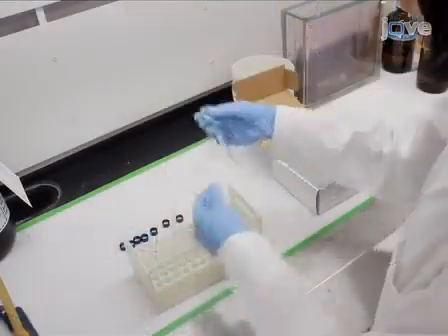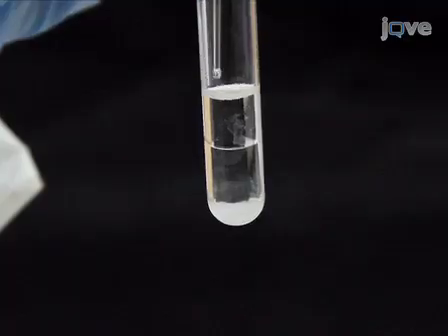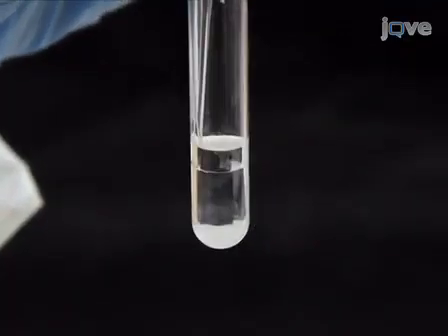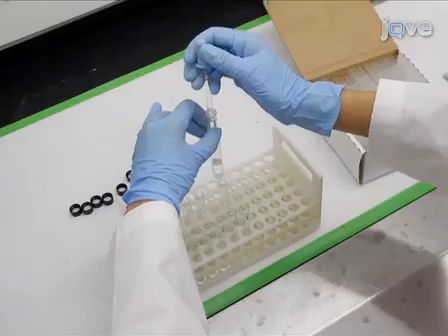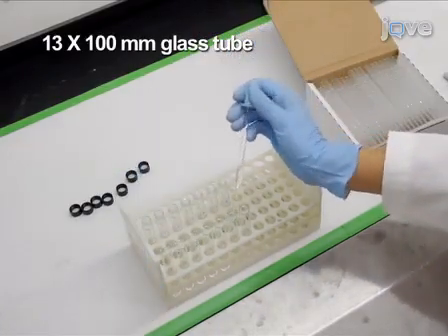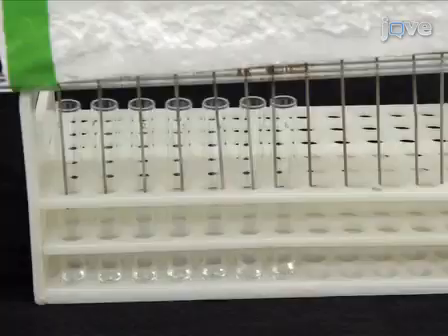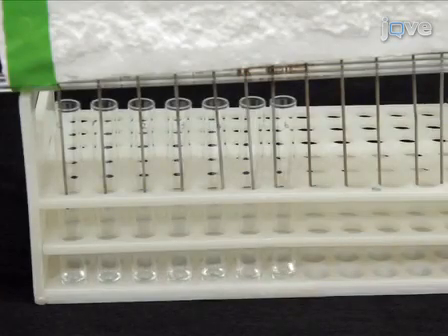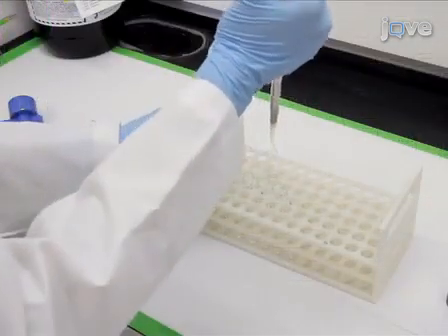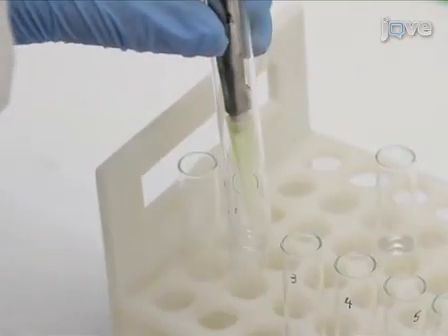Following centrifugation, remove the hexane upper layer of the sample with a Pasteur pipette in the fume hood and place it into a new 13 by 100 mm glass tube. Evaporate the hexane under a slow stream of nitrogen without drying completely. Dissolve the resulting fatty acyl methyl esters in 60 microliters of hexane.